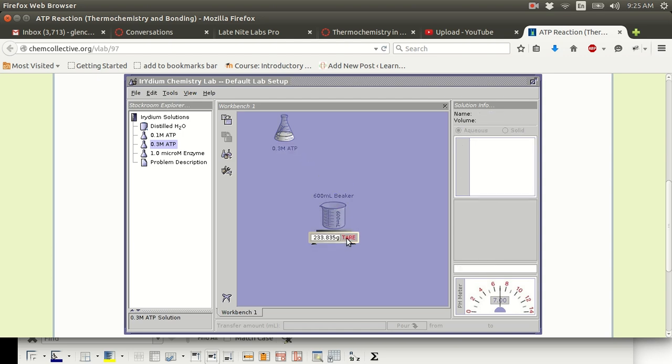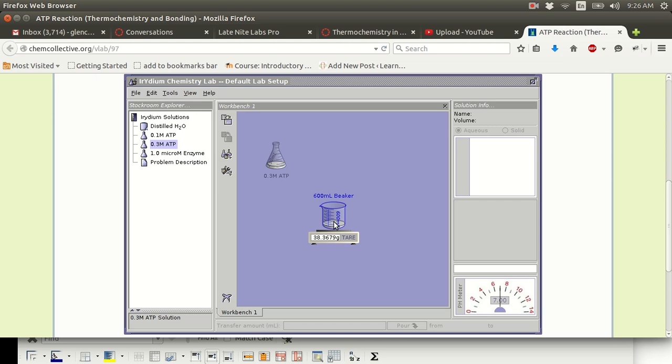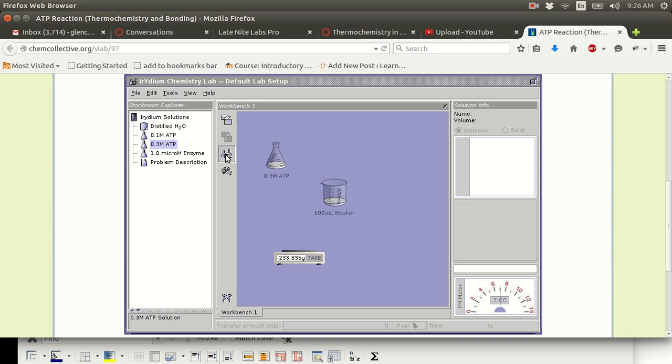So you can use the tare button to make the scale think that this beaker is 0. That means whatever goes into the beaker will be weighed by the scale. Okay. And then you can add your ATP solution. Let me try 33.3 milliliters. Okay. And then you'll be able to use the scale on this.